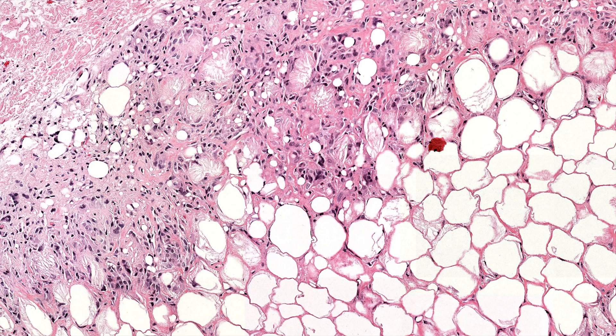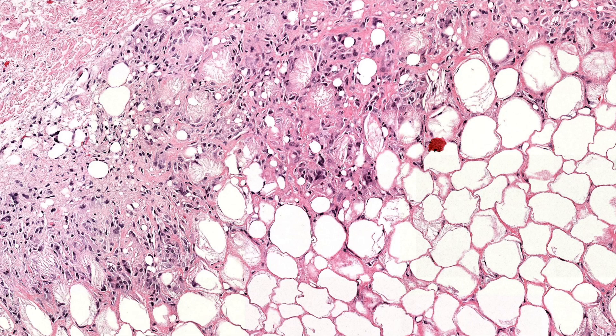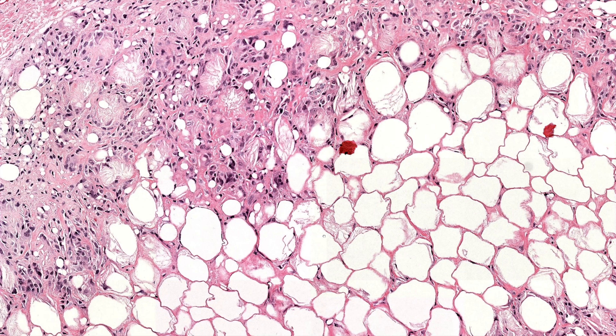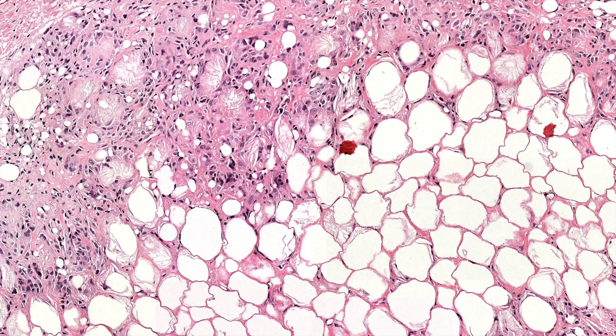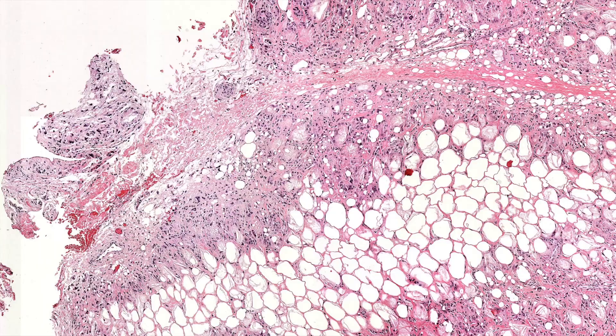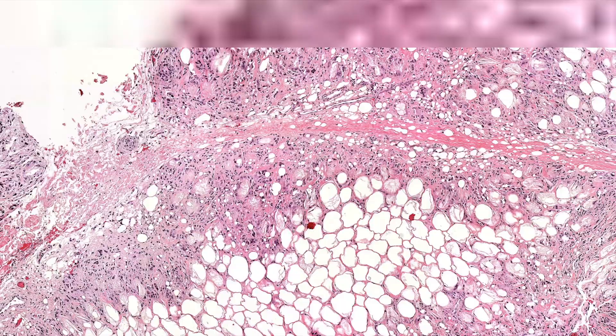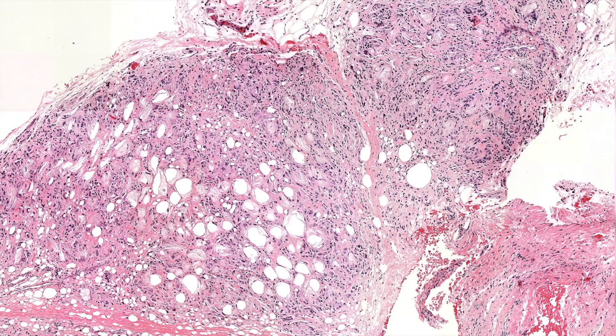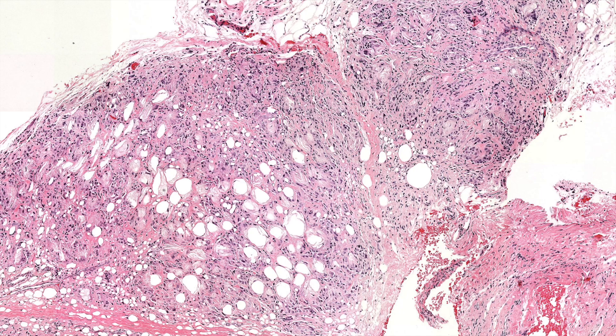These look a little bit similar to cholesterol crystals, but cholesterol crystals are usually bigger and more parallel in stacks, whereas these go out in radial spokes. This is the textbook example of subcutaneous fat necrosis of the newborn — a pretty cool appearance.